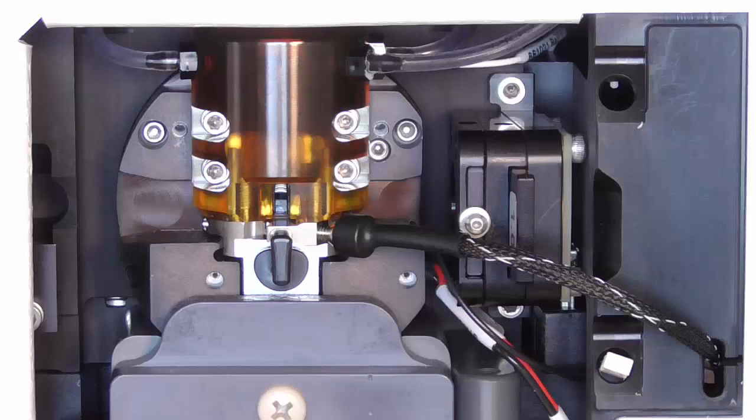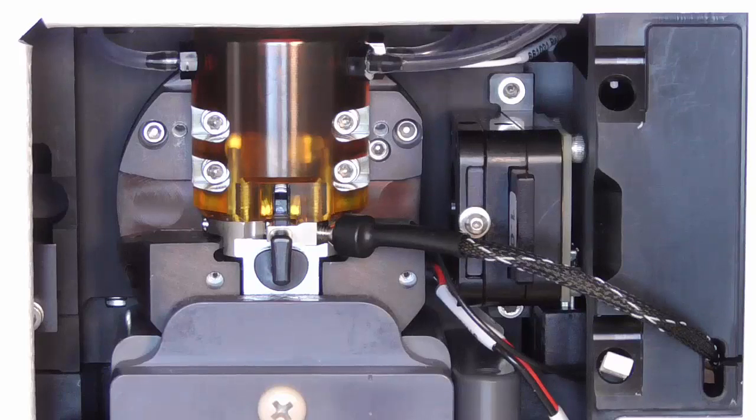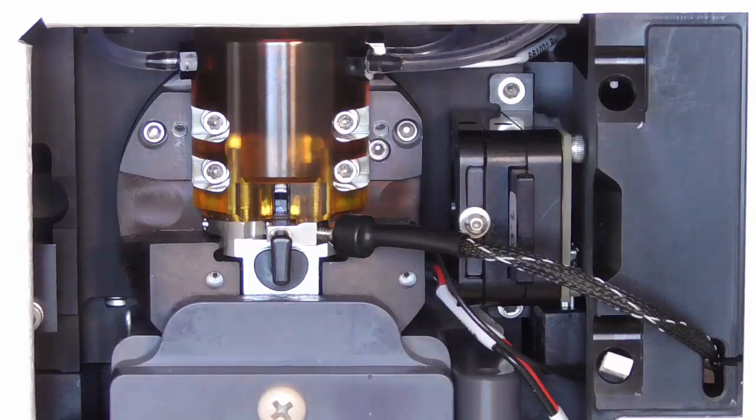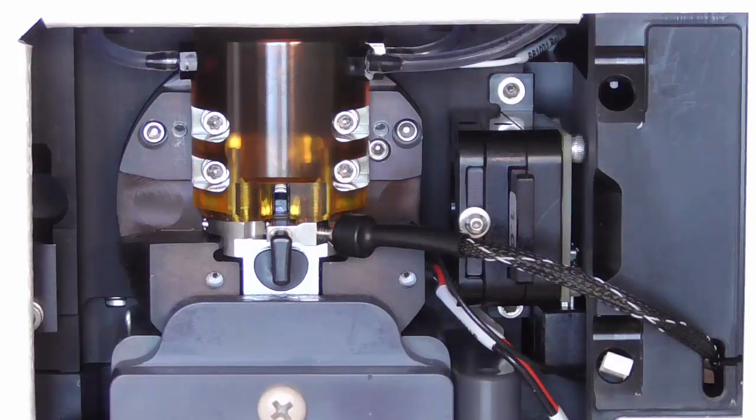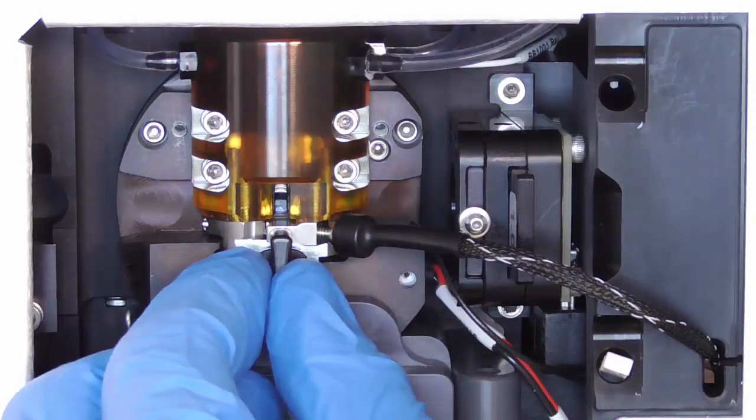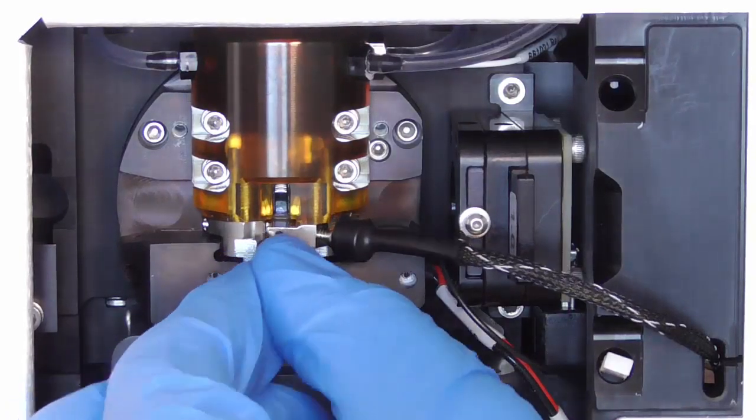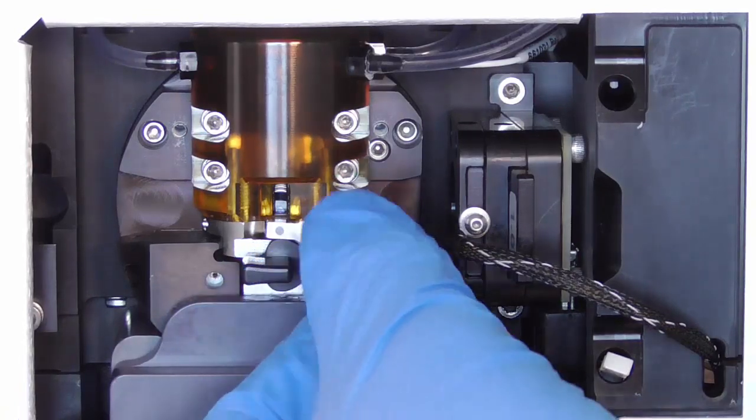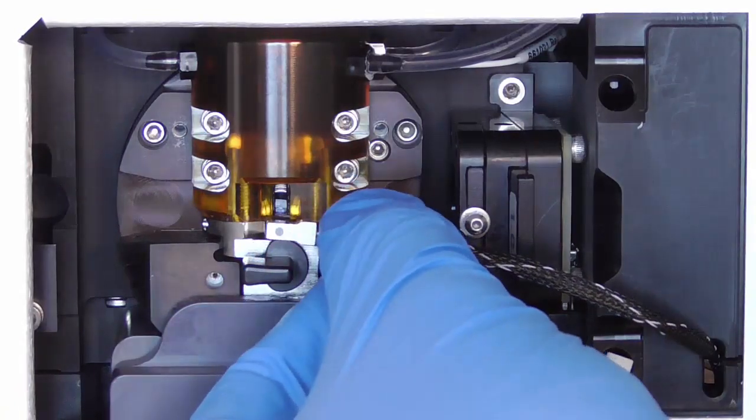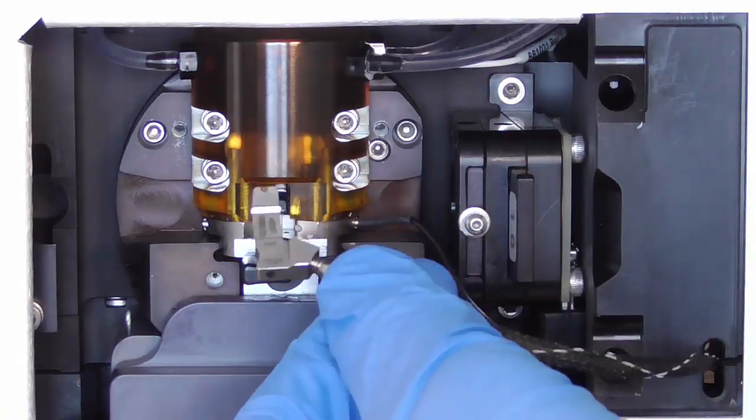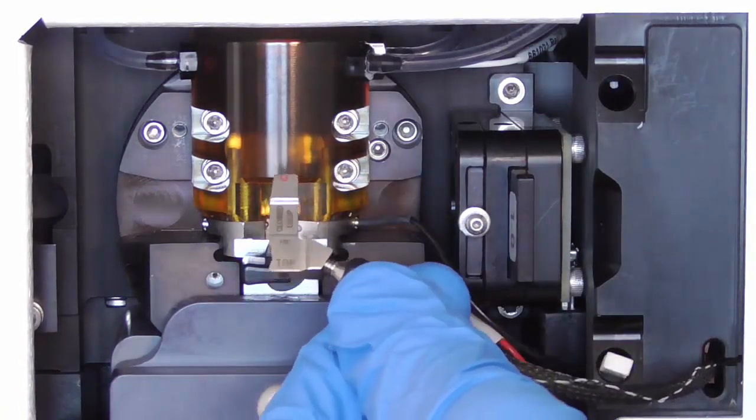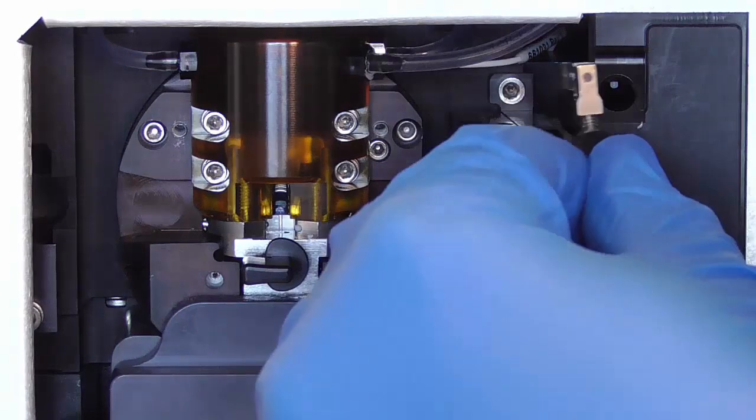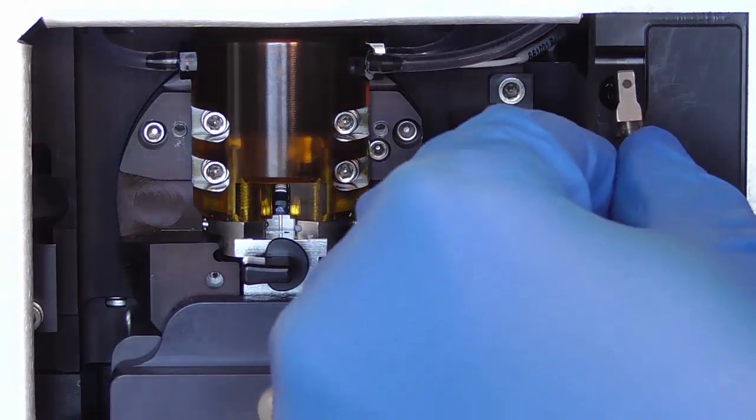To insert the sort nozzle, open the flow access door. Under the cuvette, remove the closed loop nozzle by turning the nozzle locking lever counterclockwise to the 9 o'clock position and then pull the nozzle straight out. Place it in the nozzle holder.